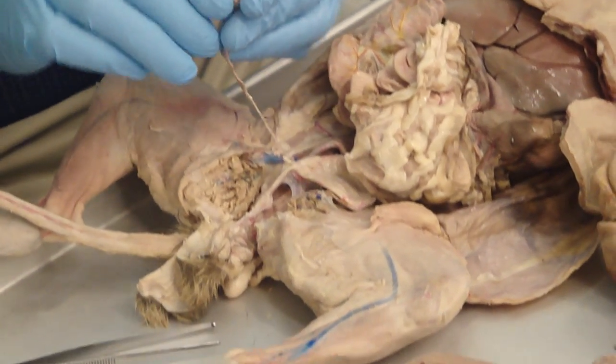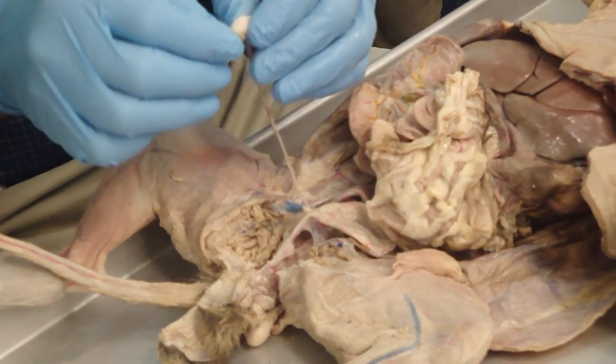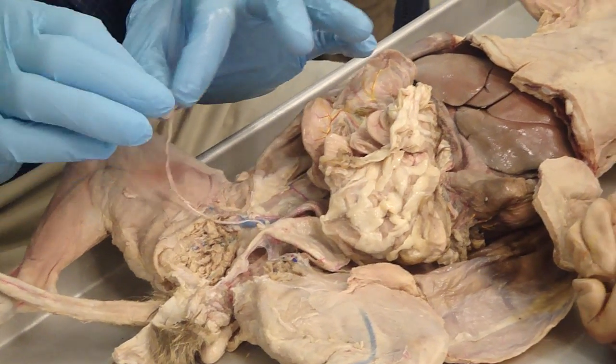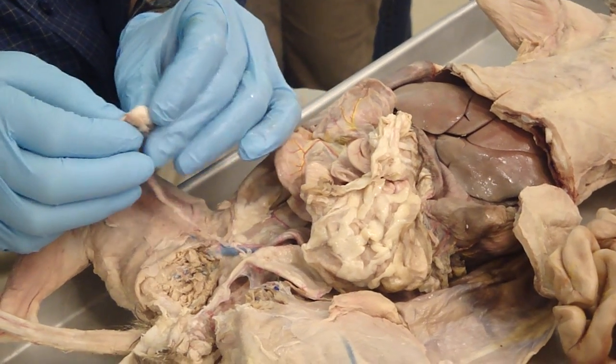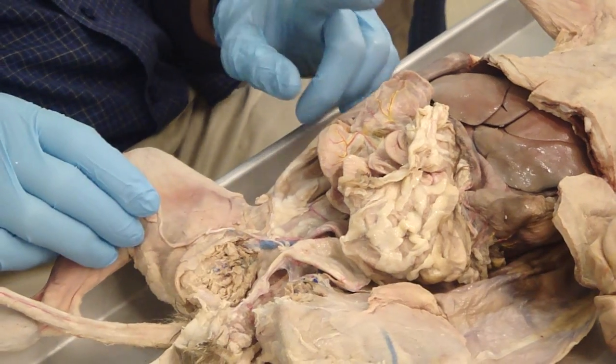And the spermatic fascia has been cut away, like in this one. If you notice, the bottom of the testis is attached to the spermatic fascia here. So to understand the spermatic fascia, where that comes from, you have to know the descent of the testes.